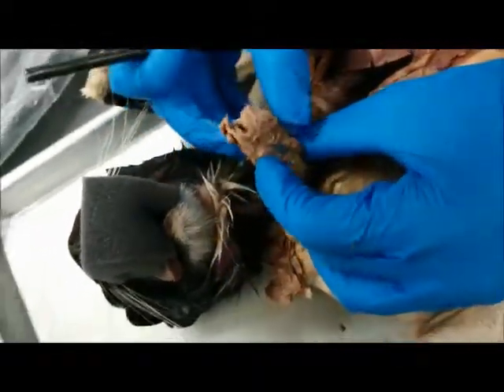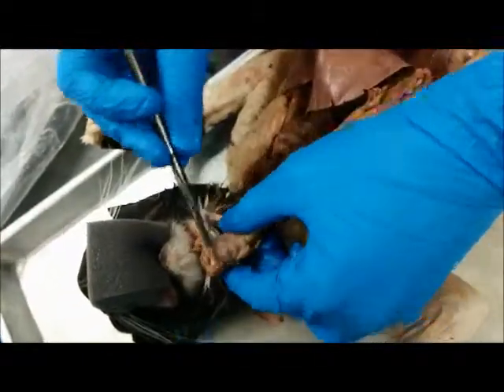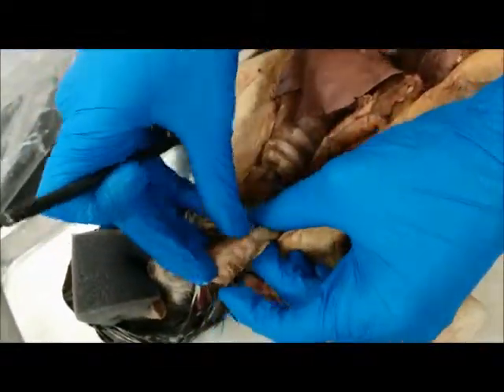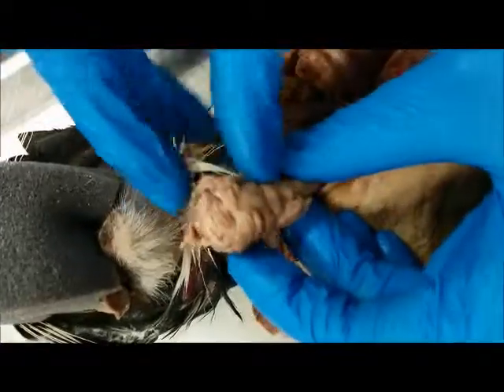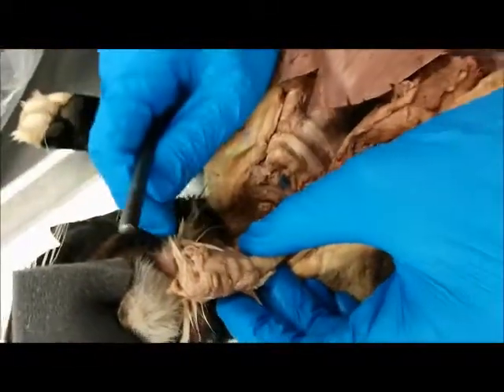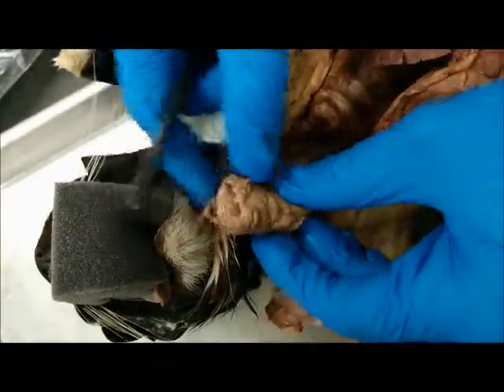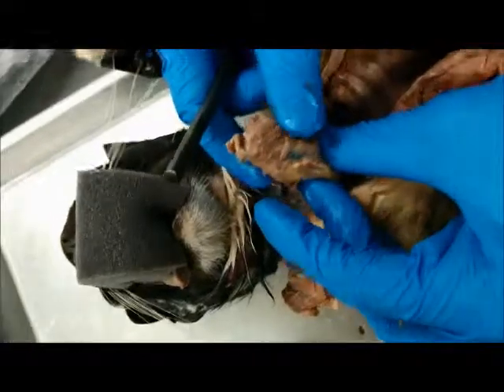Now, we also have the larynx, or the voice box. The larynx represents this portion right here. This is responsible for the cat's voice. It's also, in humans, responsible for the human voice. It's responsible for the voice you're hearing right now in this video. And I believe that is it.